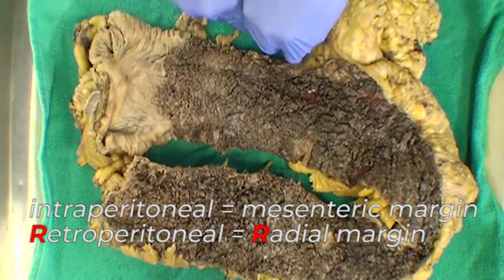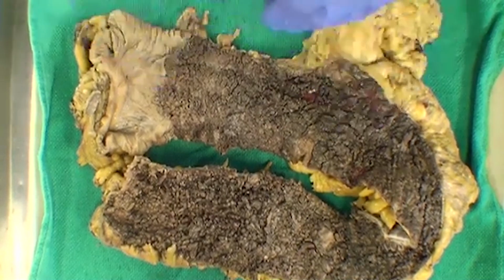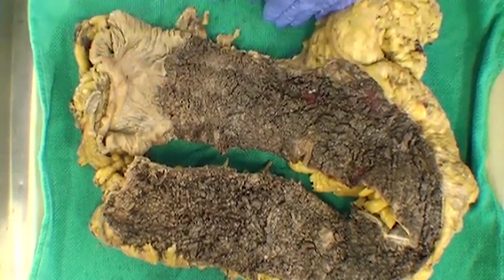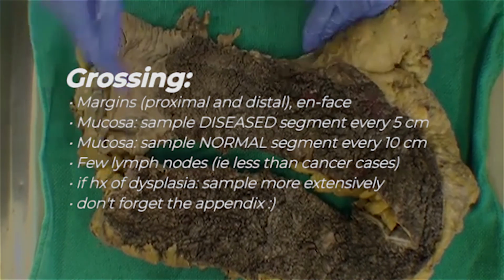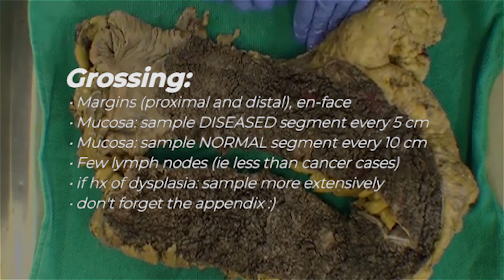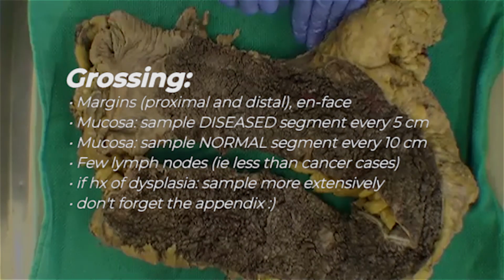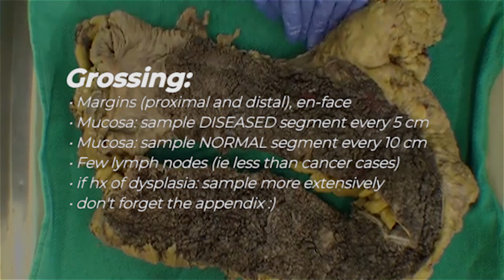as opposed to when you have a retroperitoneal segment. And so just to review how one would approach one of these specimens in terms of grossing it, as per usual, we'd be interested in taking our proximal and distal margins en face. In this case, we don't have a history of a malignancy. We're going to limit our sections to about 1 per every 10 centimeters in the uninvolved area of bowel, and then 1 per 5 centimeters throughout the rest of the involved areas of bowel.